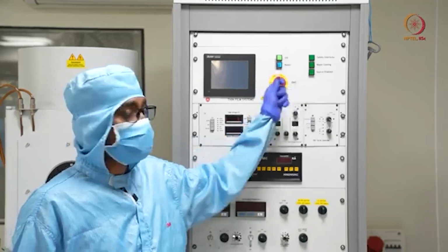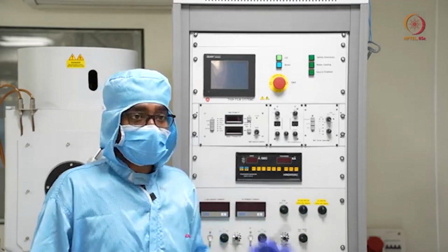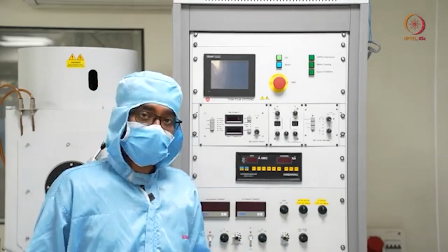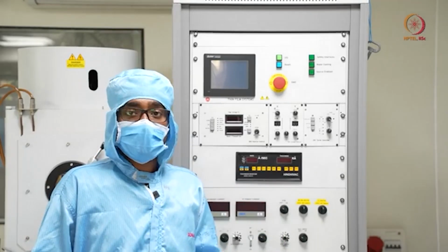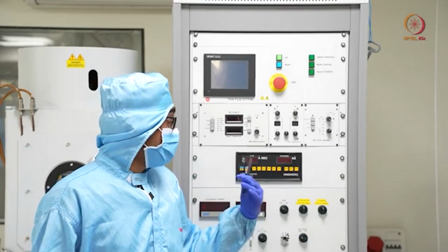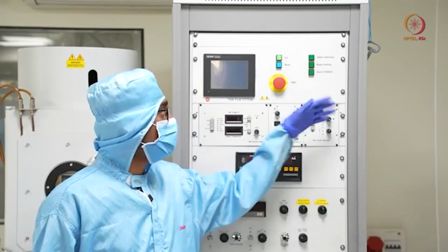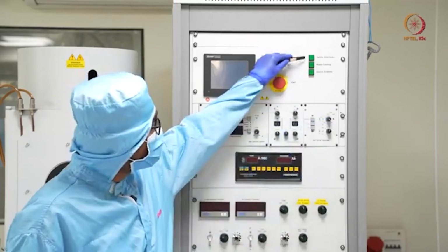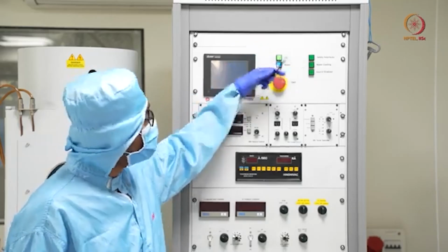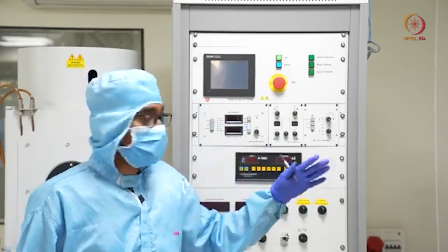And the third one is source enabled, as we are not using this tool in automated mode. There are different types of tools, as you already know. The tool can be completely manual, automated, or semi-automated. This is a semi-automated type tool. If you see any automated tool, then their source enabled part will be there, so whenever deposition goes on, it will show. But in our case, we will just check these two before starting the deposition. And here these two we will press. These are the buttons that we will press before starting the tool.